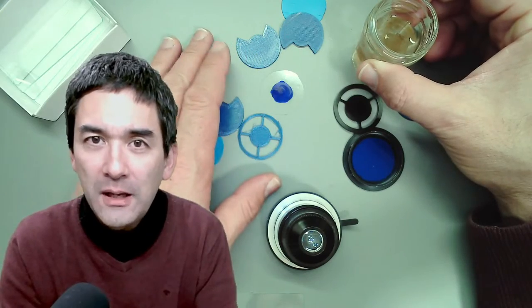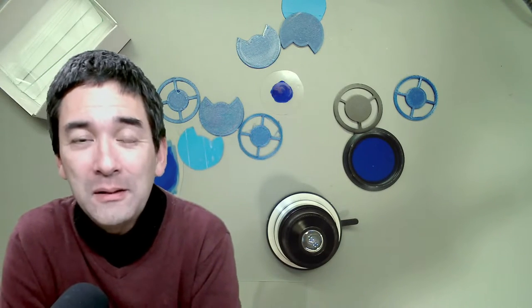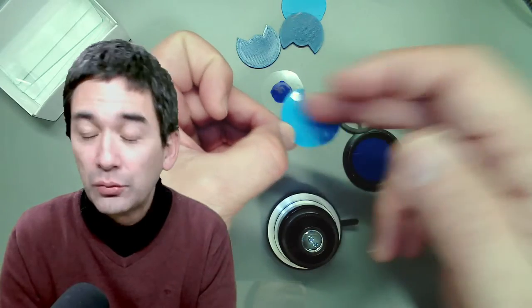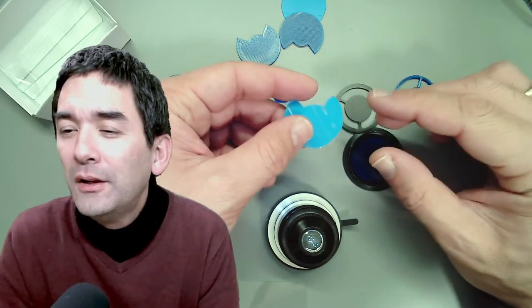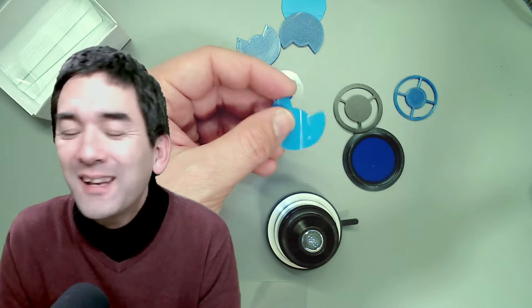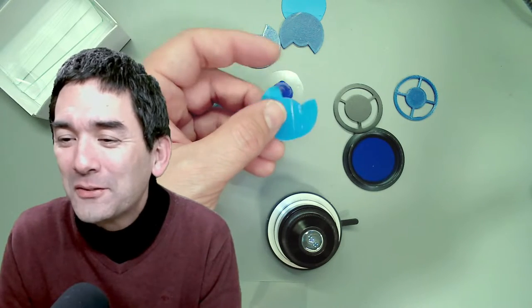I like to interrupt my live stream every now and then to look at comments. Feel free to ask questions — some might be a little bit off topic but I'll try to answer them as long as they are microscopy related. Someone asks about a 50% cutaway filter — that would be a filter cut across with no center divider. Hello from South Africa — I love it if people start to love the hobby!